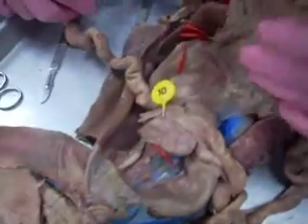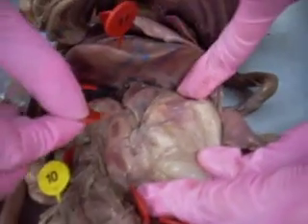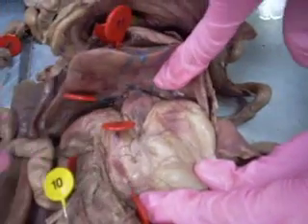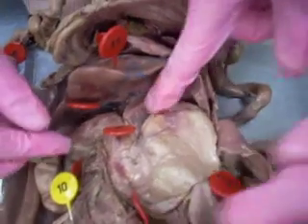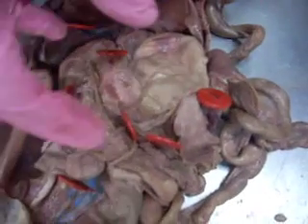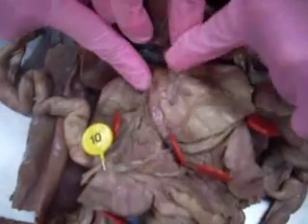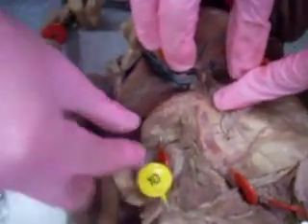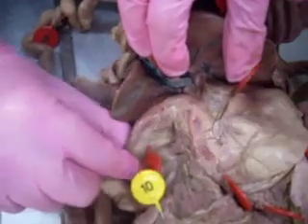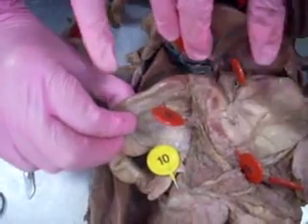Lifting underneath the stomach, the top of the stomach is known as the cardia, where it connects to the esophagus. This is the fundus — the curved head — and the body. The bottom segment is known as the pylorus. If you cut that open, you would see the pyloric sphincter and the pyloric canal, leading right to the small intestine.